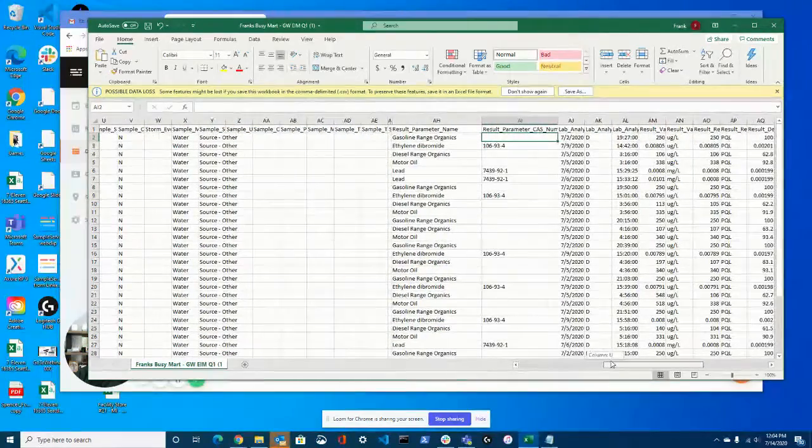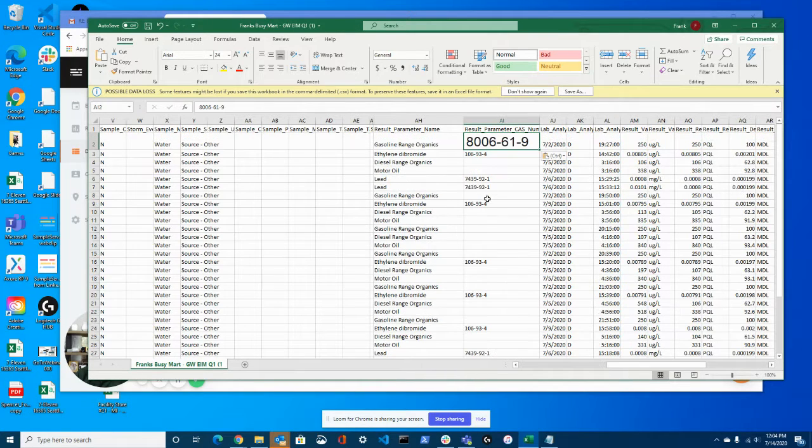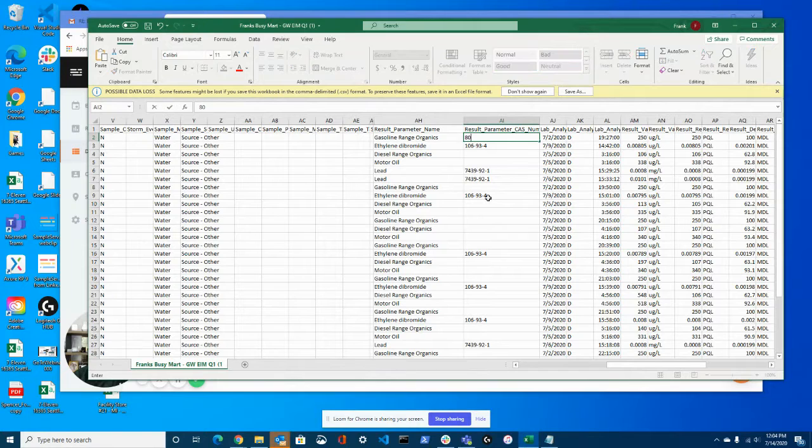But find the column that has your chemical names and your CAS numbers. In this case, you can see a lot of CAS numbers are inconsistent, or actually missing, so it's going to be really hard to report on. And I'll just correct a few of the CAS numbers. 8006-61-9, I had that wrong. And I'll fix that just for these. Obviously I'm not going to fix all of them because this is just a really short demo, but make the changes. You can also change the wording and the names if you need to.